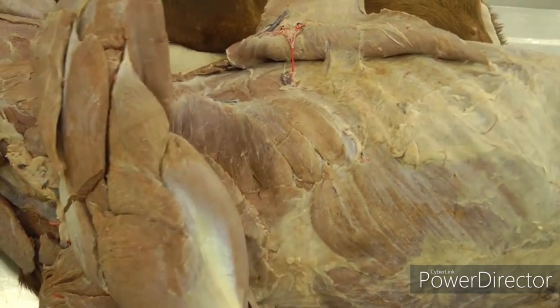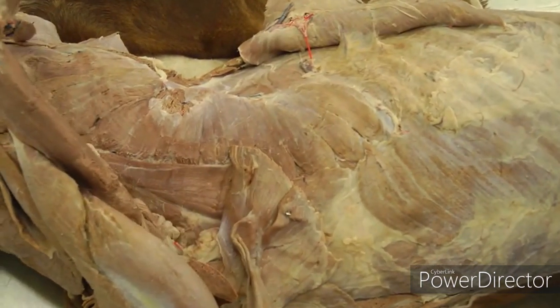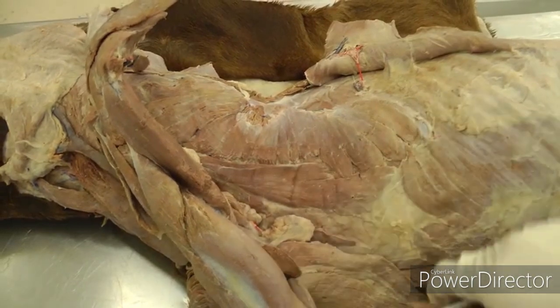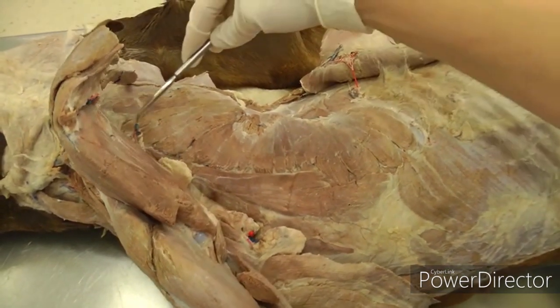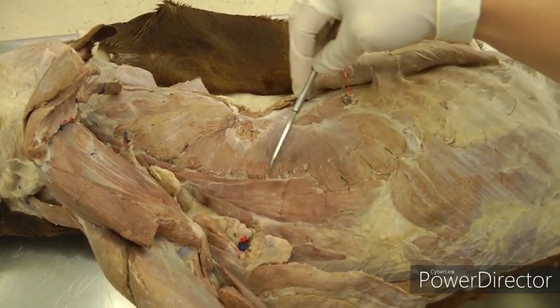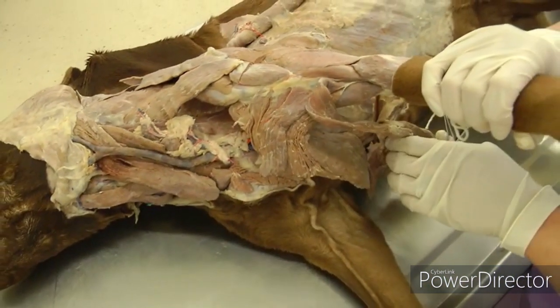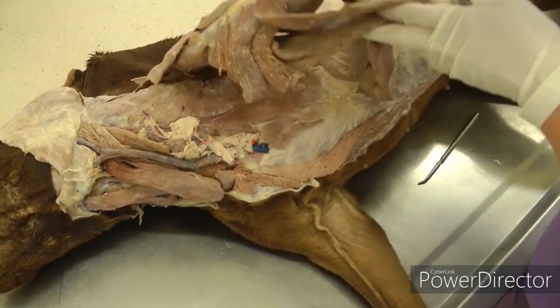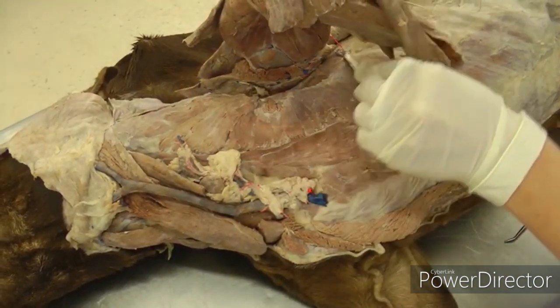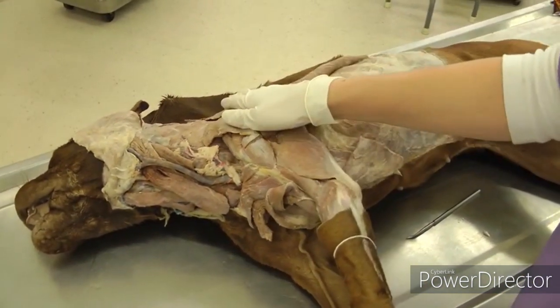Now if you flip the arm forward you can see the serratus ventralis. Mine has already been transected, which you will do in your lab also — you'll transect the serratus ventralis away from the limb. Serratus ventralis has a cervicis part and a thoracis part. You'll lift the limb up — having already transected your pectorals and other extrinsic muscles — and eventually see serratus ventralis. Continue to lift, make a cut along that scapula, and remove the forelimb from the body so the forelimb is separated.